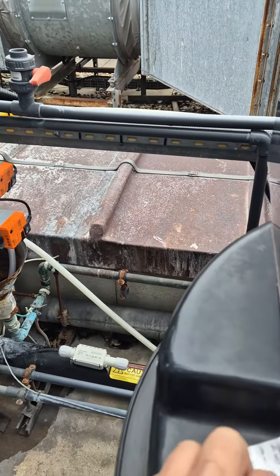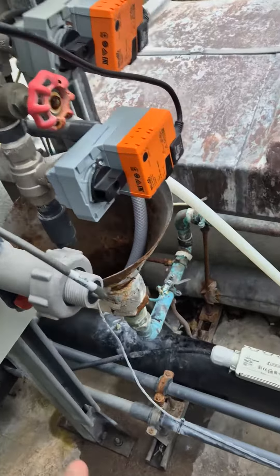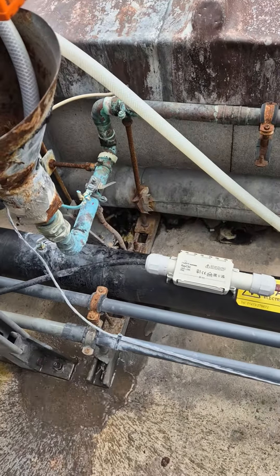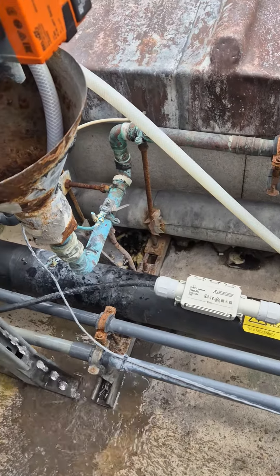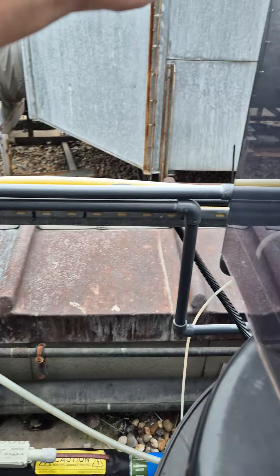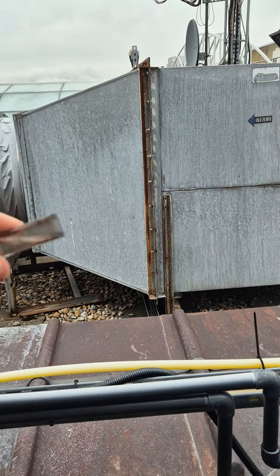How to take your bromine samples. Go to whichever tower you want to start on — I'm going to start on tower one. Run the water and fill the little capsules up. You want it roughly about 10 milliliters, so pour it out to 10 milliliters.